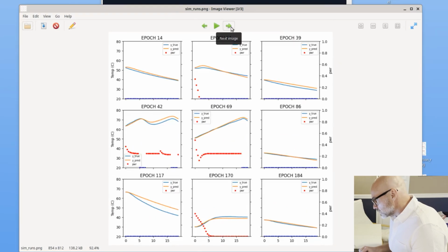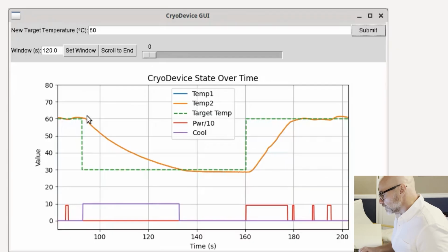And then this is what I'll show in a second. This is it actually controlling the temperature. So here it's up at 60 degrees, and then I command it with the green line to go down to 30 degrees. And that's when in this plot, this purple is when the cool is on. That means when it's plunged, so that it plunges till it gets down to that 30 degrees. And then I changed it and said, okay, now I'll go to 60 degrees again. And then it turns the power on, then turns the power off, and then needs to keep it on. So again, there's a lot that can be improved, but it's time to move on. So maybe others I could bring on and they'll have time to keep improving this.